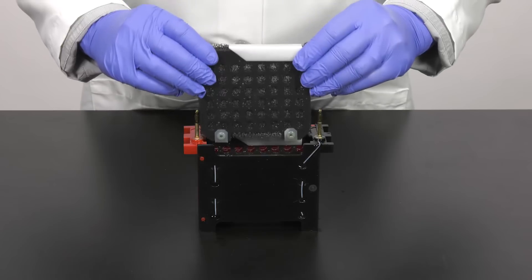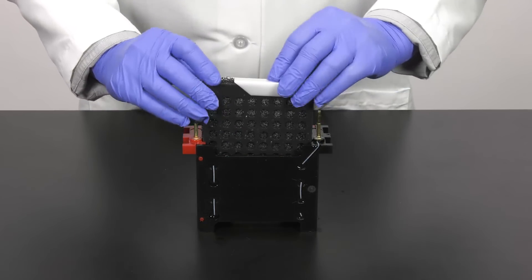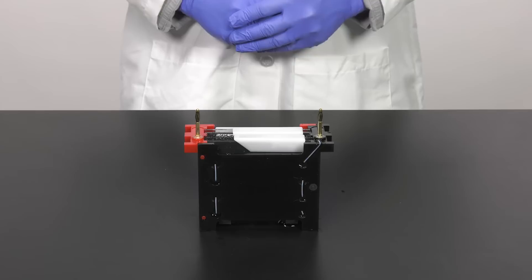Insert the gel holder into the inner module. Make sure the black side of the holder faces the black side of the module.